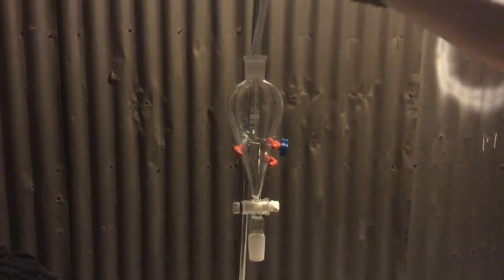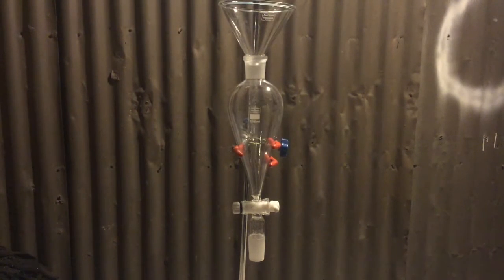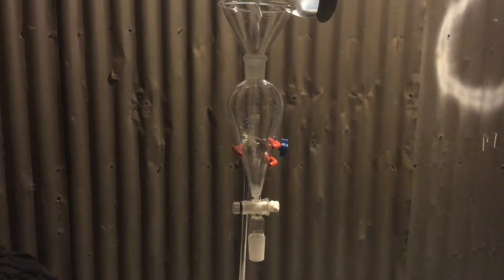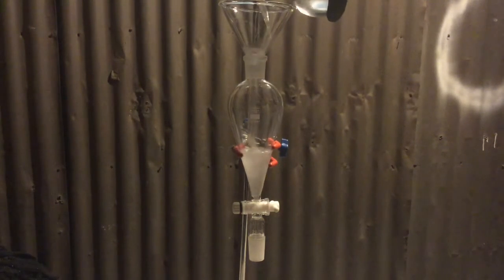The DCM was then transferred to a separatory funnel to be washed. As I mentioned before DCM and methanol form an azeotrope, however washing the DCM with water can break it.